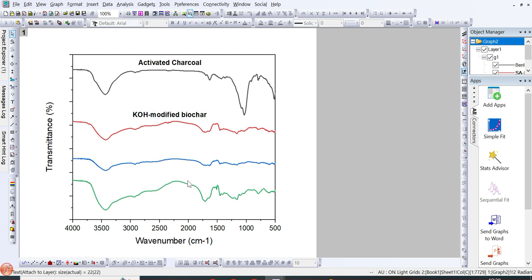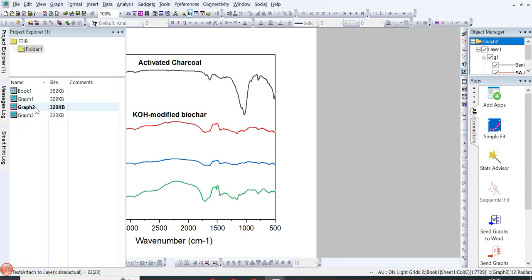And for example, if you want to mention the wave number on the FTIR spectra, then you can click again on the text tool, and then here, for example, if this is nearly about 3500, you can simply write it as 3500. You can make it bold by pressing Control A, so the data will be selected. You can then press Control B, or bold it from here, and increase or decrease its size like this. So in this way, you can mention the name of each spectral line, and also mention the wave number on FTIR spectra.